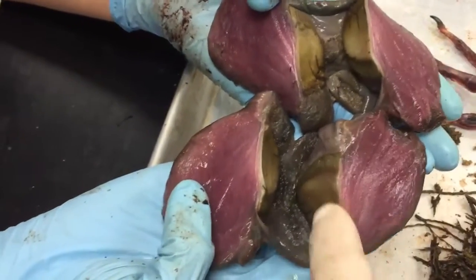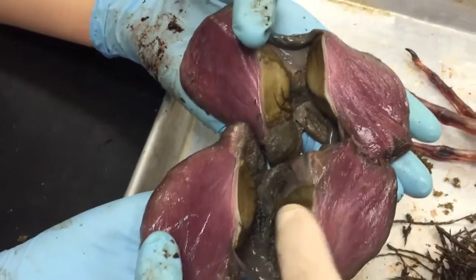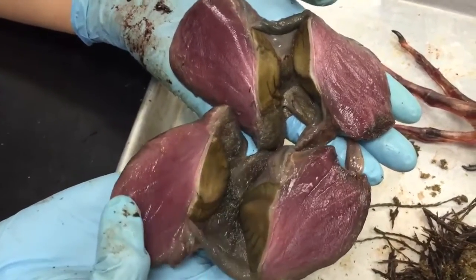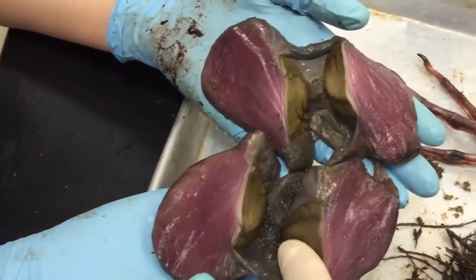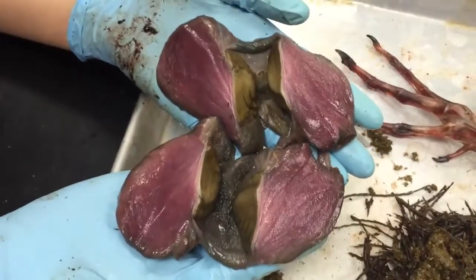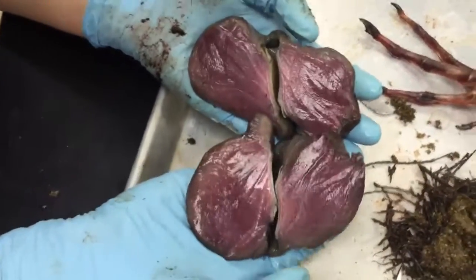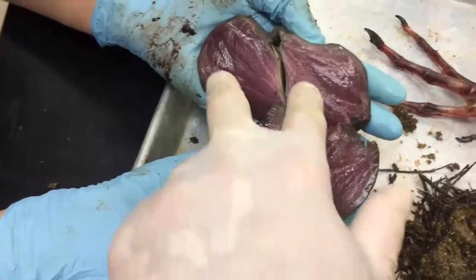We washed it out, but there was all kinds of grit and small stones in here too. These are herbivores taking fairly coarse vegetation — grass, grain, things like that — and they chuck it down. It comes in and just basically gets chewed up in this area. You can sort of see how much muscle there is; these are in a sense the masticatory — the chewing muscles.